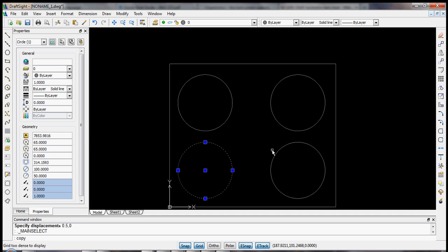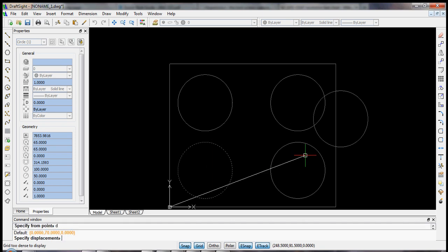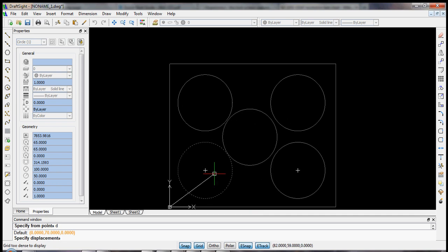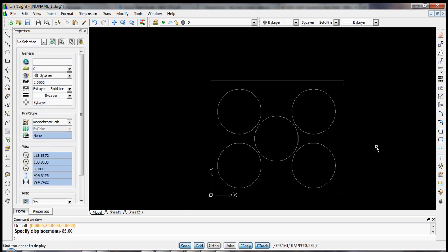So let's copy this one, and we'll do displacement again. Now, going all the way was 170, so we're going to move it over by 85 millimeters. And again, the upper row is 120 millimeters above, so 60 would be half of that. So we'll do 85, 60, and we should get this right exactly in the middle.